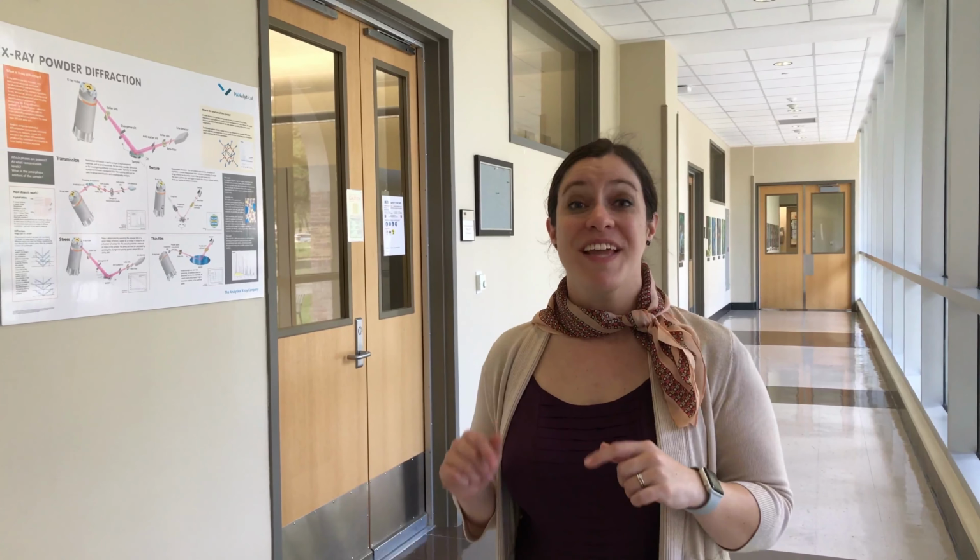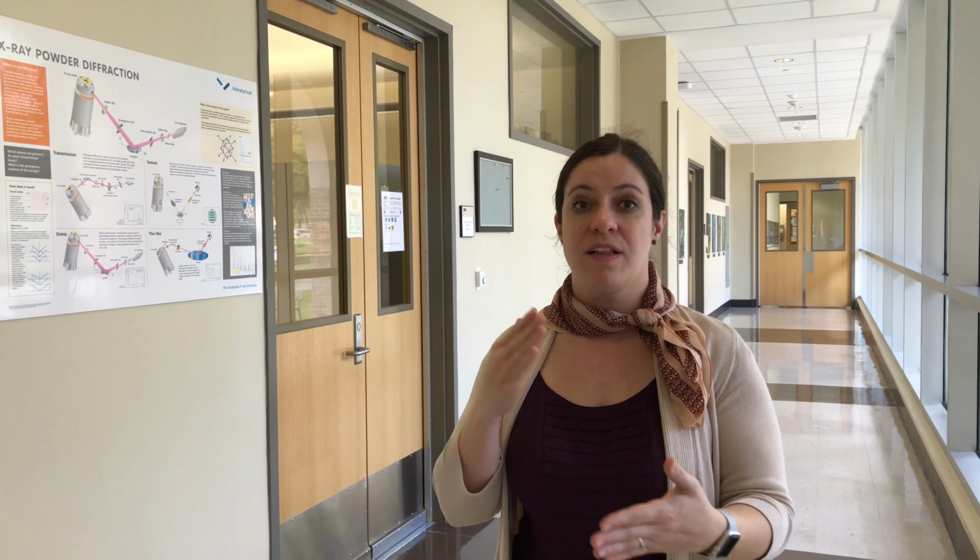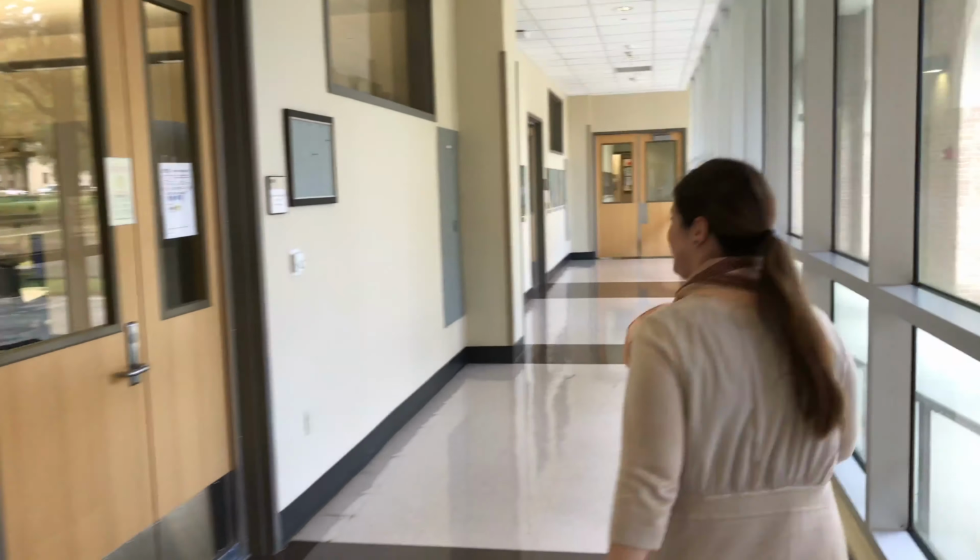All right, you guys, we are now in the Shared Instrument Facility. This is on the first floor of the Chemistry and Materials building. And this is an instrument facility that is a collaborative endeavor by multiple departments. Biology uses this, chemical engineering uses this, and a few other programs depending on what their needs are. It houses several different instrumentation. So we're going to walk down the hall and meet Dr. Dongmei Cao, who will give you a tour of all of the different types of instrumentation that we have in this facility.